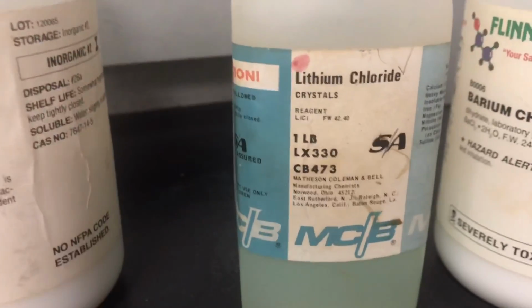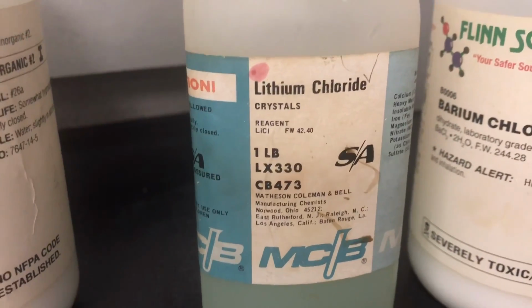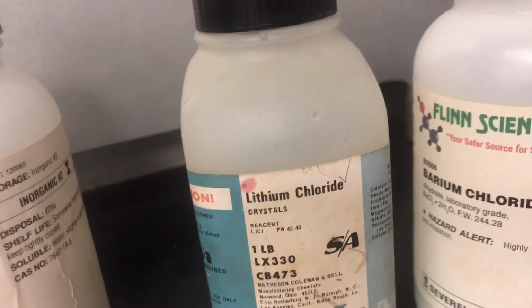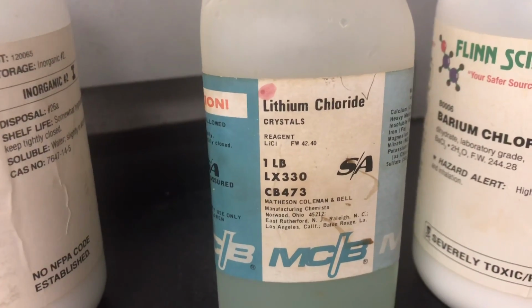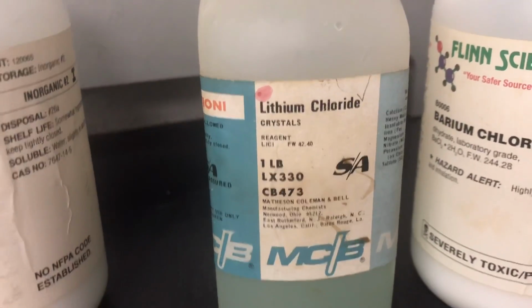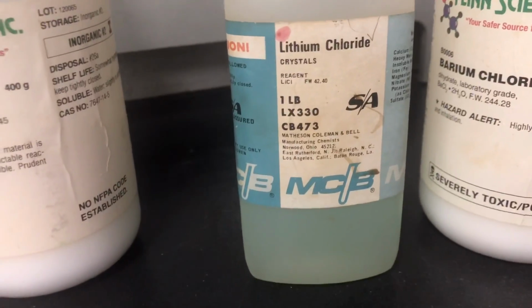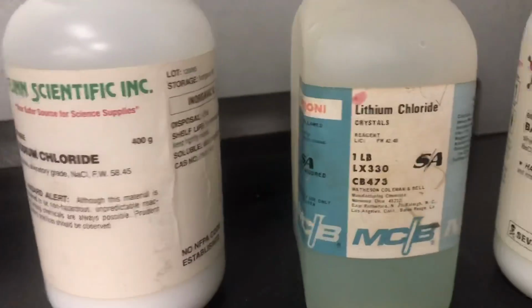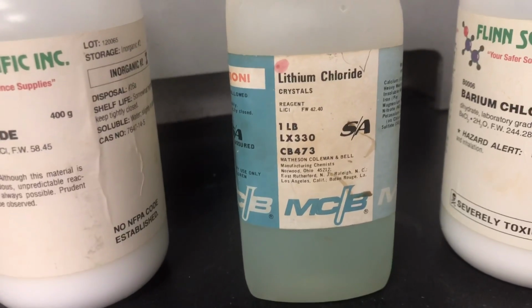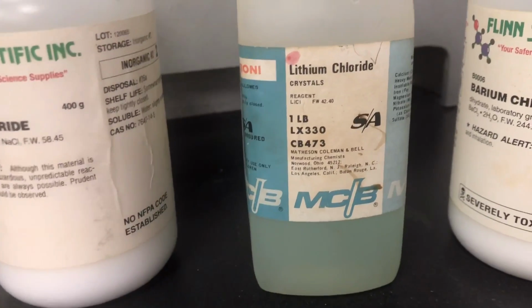It's an old sample. And remember in a couple labs ago, you had to look up the word hygroscopic. Well, this is even further than hygroscopic. It is so hygroscopic it's considered deliquescent. And so if you would look up what deliquescent is, this one is actually in liquid form. Originally it was solid, but over years and years, because it is deliquescent, it has turned to liquid.